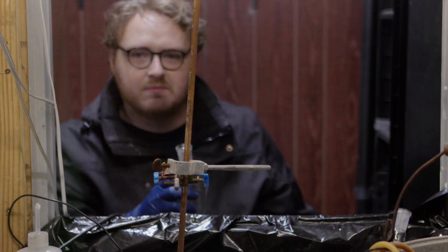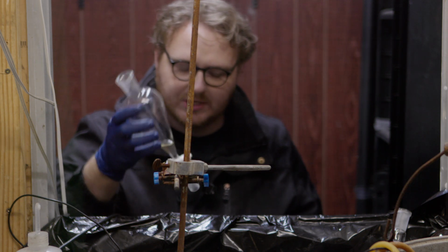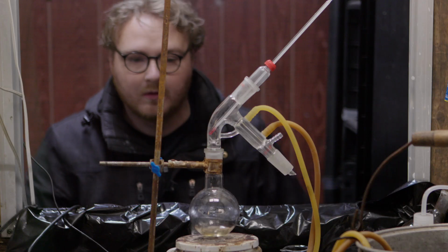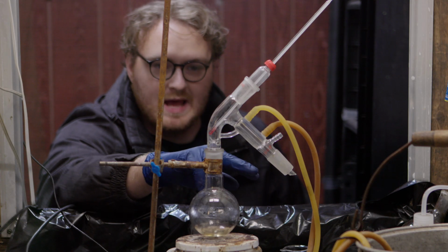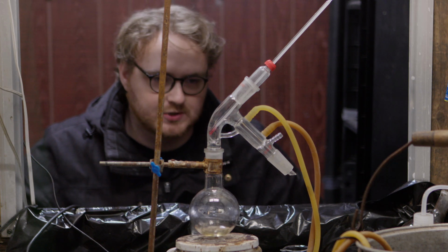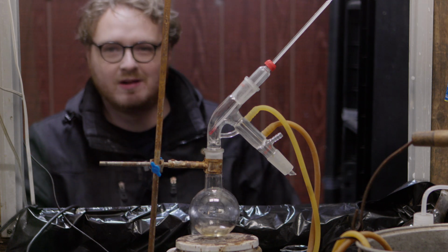Maybe it smells a little nutty, but I don't really think the propanol is washing out, so I think we're going to go ahead and do a distillation. Alrighty, to finish this off, we're going to do a short path distillation. Not the best at separating things, but we have a very small batch, so I just want to see if we can get even a little bit out.